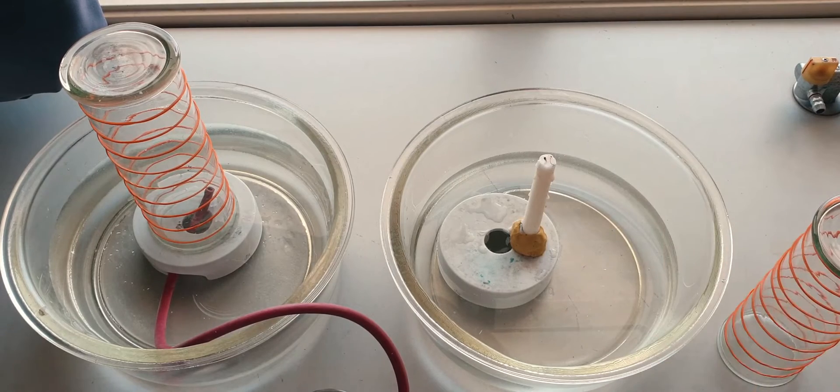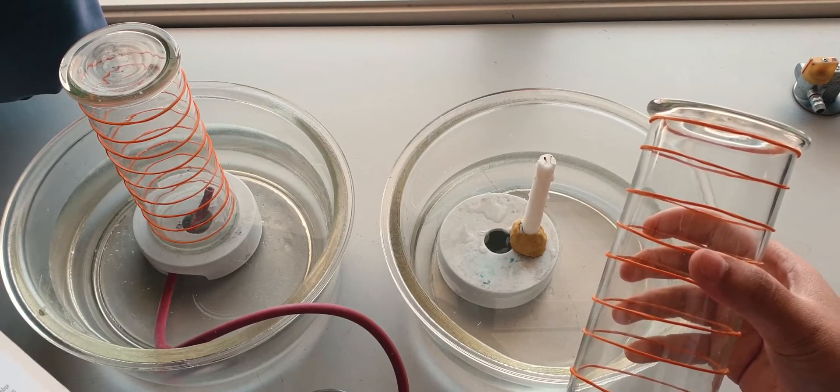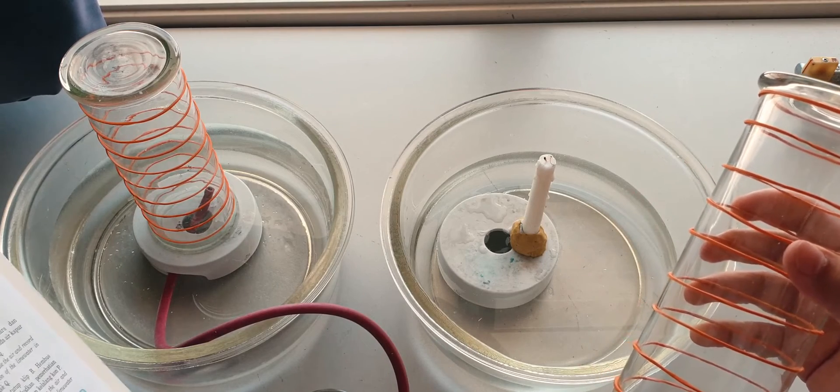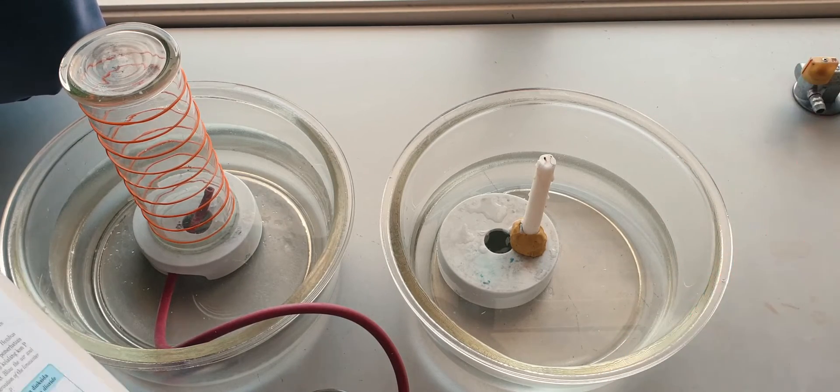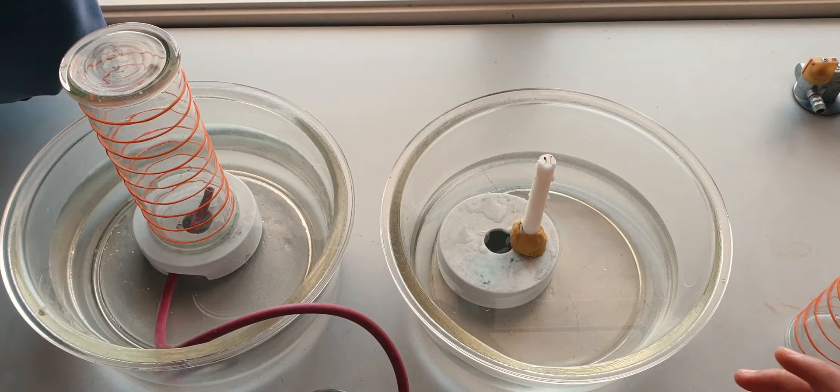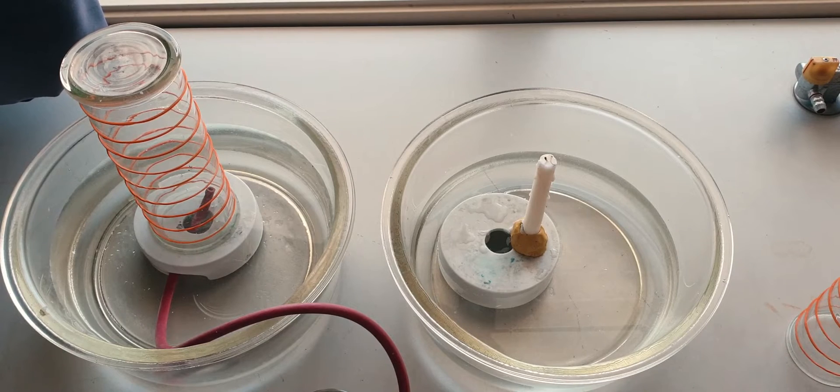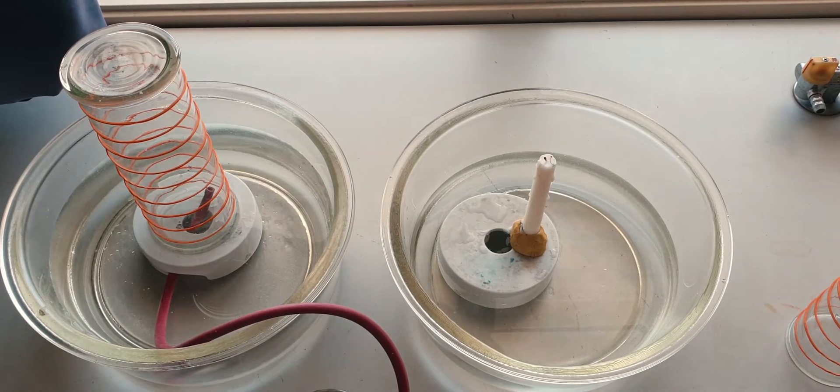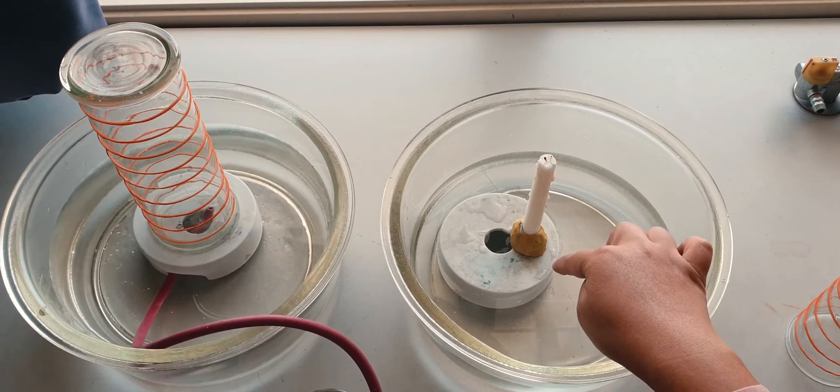Rubber bands, okay, rubber bands that are already put on the gas jar, and you need a glass trough. I actually need only one but I use two glass troughs.